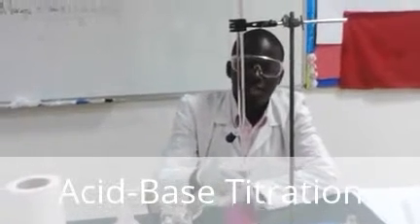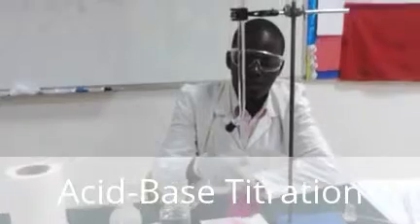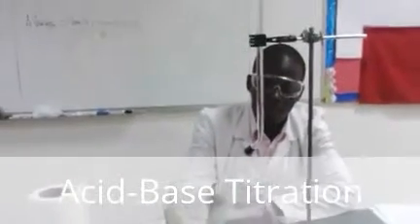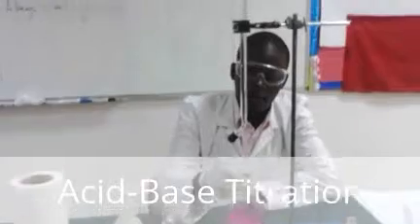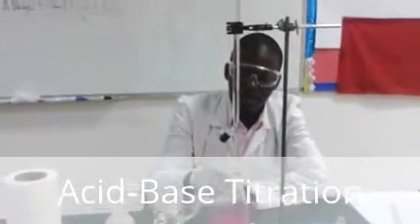So I'm rushing because I know exactly where the end point will be. But you are supposed to go slow by slow, because when you rush, you may bypass the end point.